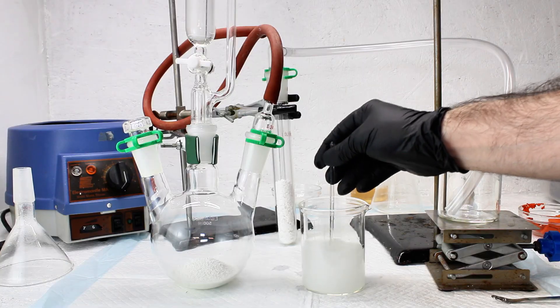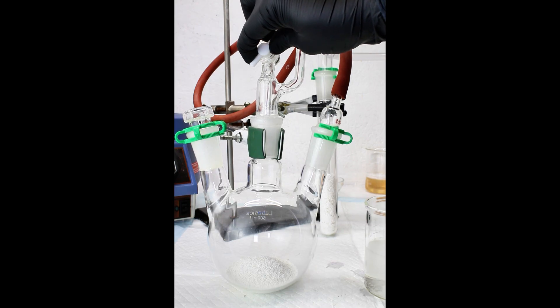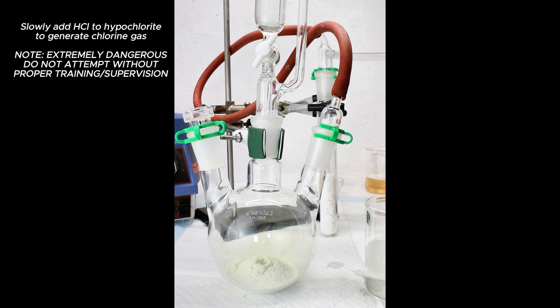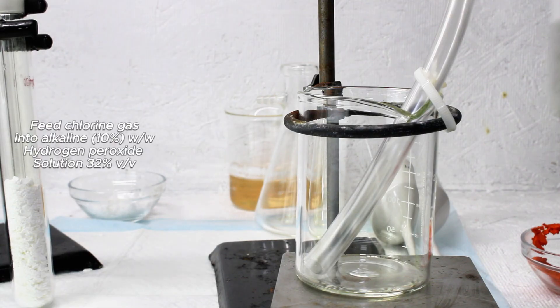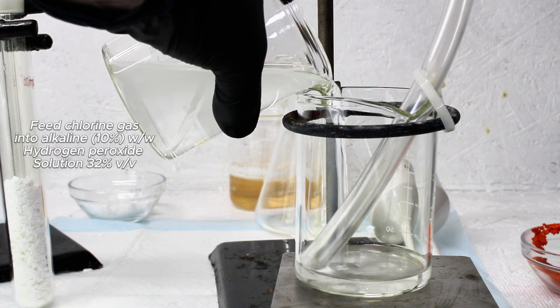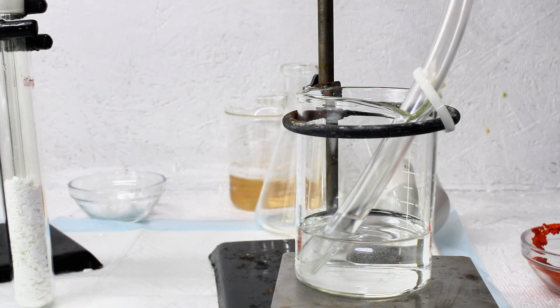One way I found to make the light produced both brighter and more sustained is to react alkaline peroxide directly with chlorine gas. To do this, I set up a simple chlorine generator by dripping hydrochloric acid onto calcium hypochlorite. I then fed the chlorine gas produced through a cold finger packed with calcium chloride to dry the gas. Once the chlorine gas is dry, it's fed into a beaker containing 32% hydrogen peroxide mixed with some sodium hydroxide. These three chemicals immediately react forming water, sodium chloride, and singlet oxygen. With this method, you can not only see the chemiluminescence within the bubbles, but also across the surface of the liquid, which I think is really cool.